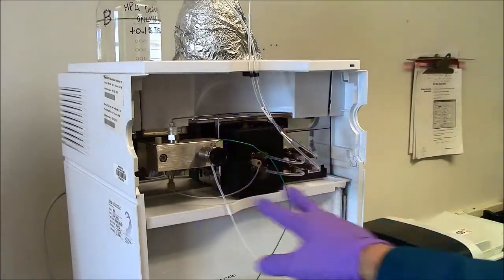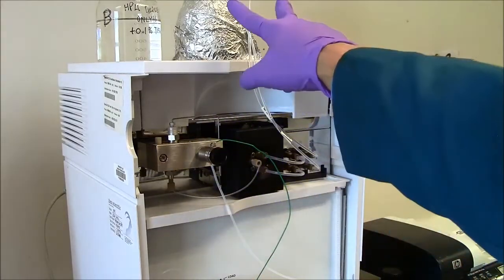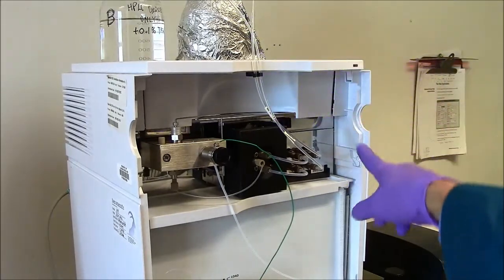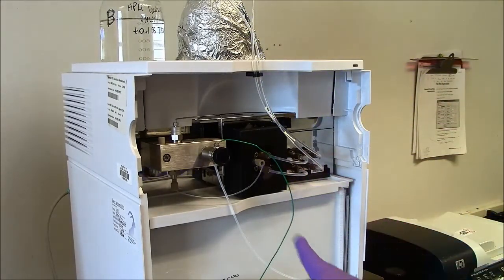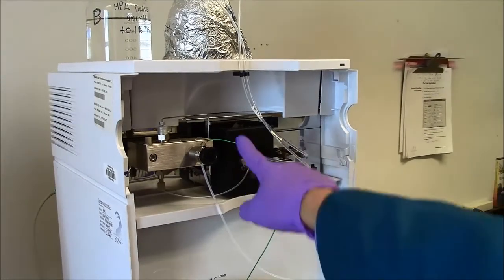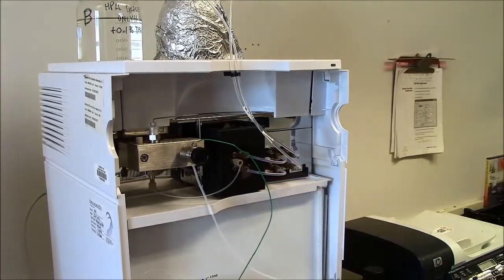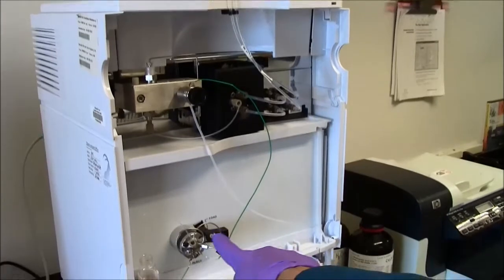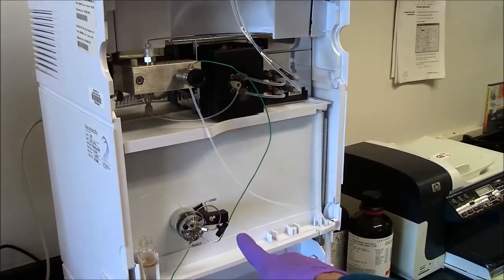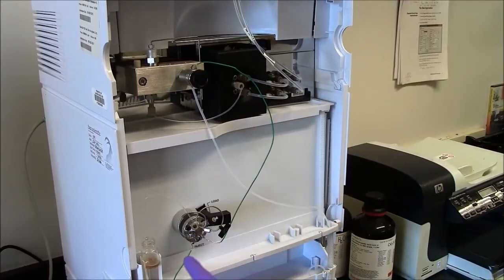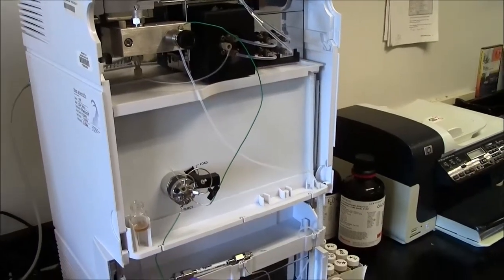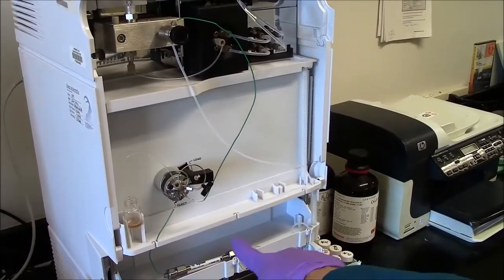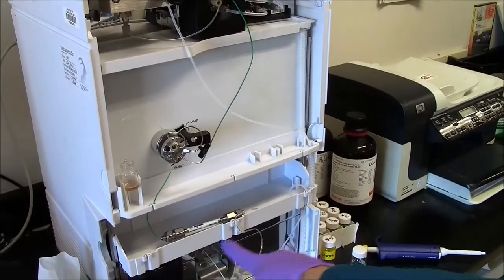This part of the HPLC is a pump. It draws from the two solvent bottles up top, mixes them here, and sends them through this capillary tube to the injection loop. From the injection loop, the solvent mixture, which may be carrying sample, goes into this column.